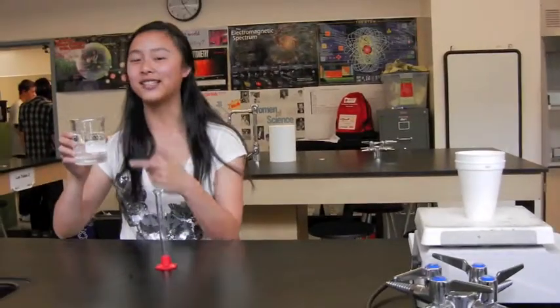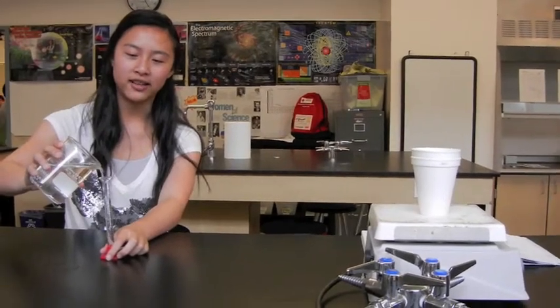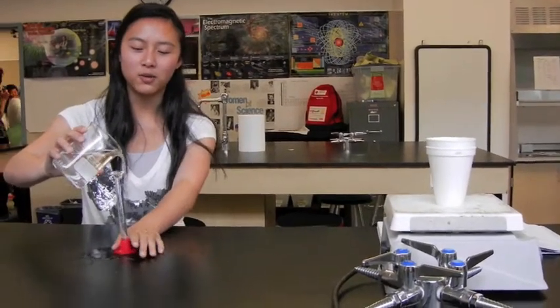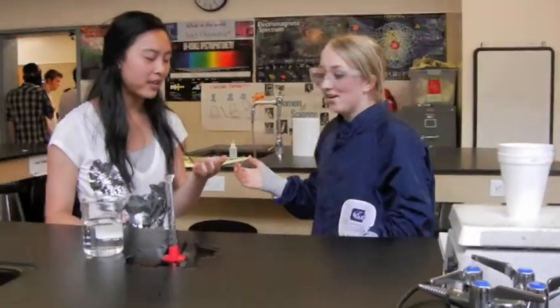I think I'm going to measure this acid now. This is acid. Okay. Right? Oh yeah. Okay. Oh no. Oh. Kathy, what are you doing? I think I spilled acid on it. It burns.